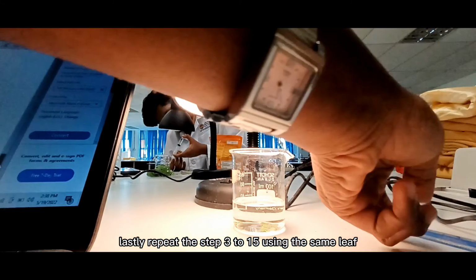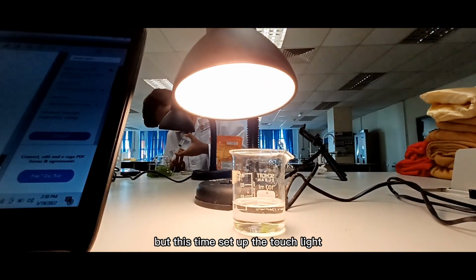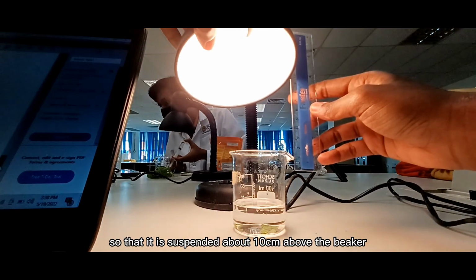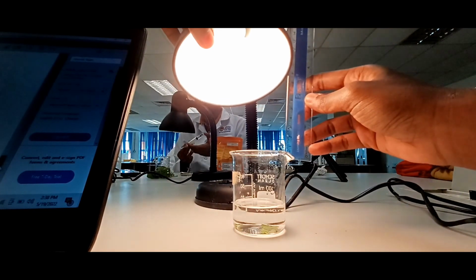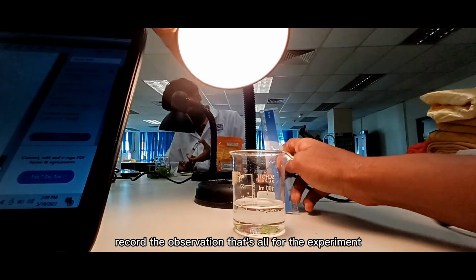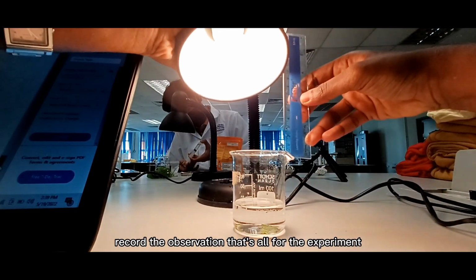Lastly, repeat steps 3 to 15 using the same leaf, but this time set up the torchlight so that it is suspended about 10 cm above the beaker. Record the observation. That's all for the experiment.